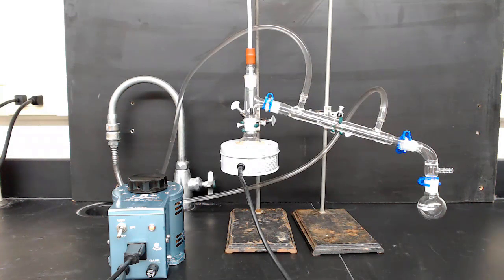When the distillation is complete, turn off the power and lower the heating mantle to allow the distillation flask to cool. Wait till the apparatus is cool before you disassemble the hot parts of it. This will prevent vapor from entering the lab.